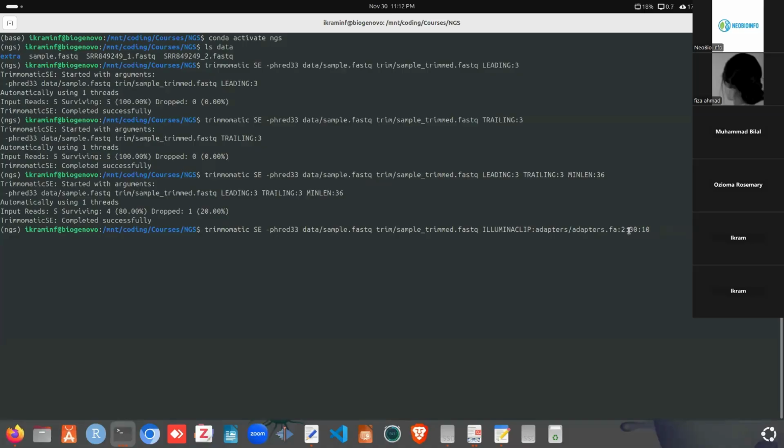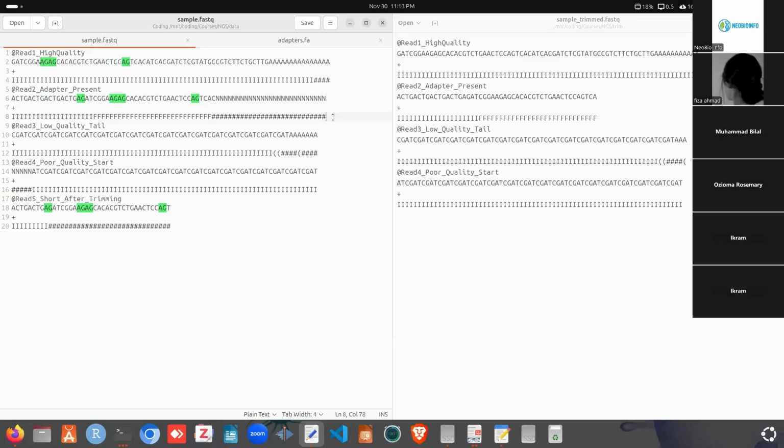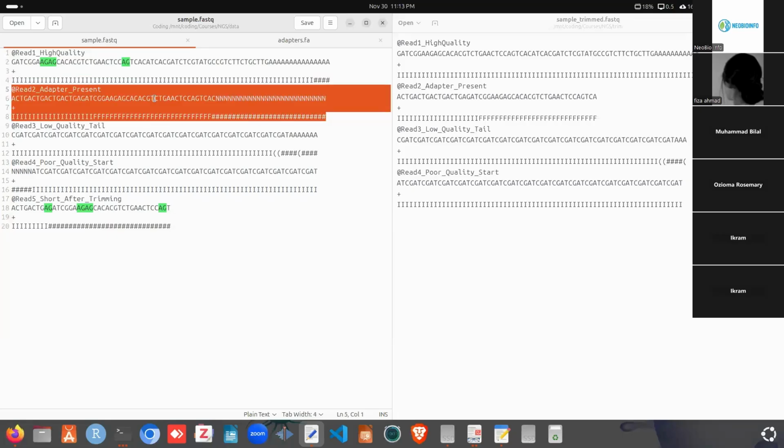And after that, the palindrome clip threshold is actually used for the paired-end reads, and then the simple clip threshold. So we can consider that the adapter sequence will be aligned with the reads. After aligning, we will have some alignment score. If the alignment score is less than 10, then we won't trim the adapter content. But if the alignment score is greater than 10, we will trim that. So we can see we have the exact match for read 2. We found the exact match for read 2, so read 2 will be removed after that command. And if there is some read that has an alignment score greater than 10, then it will be removed also.